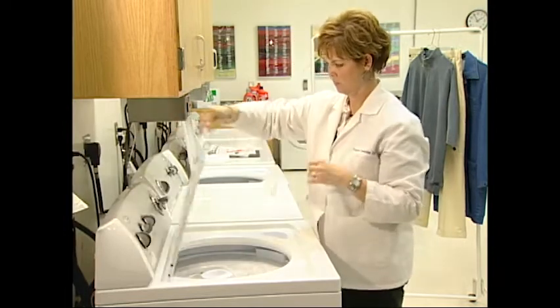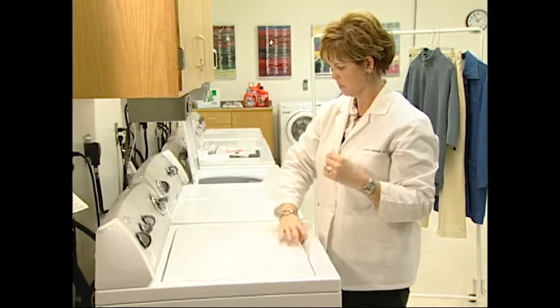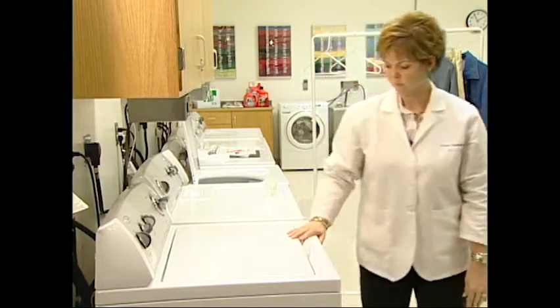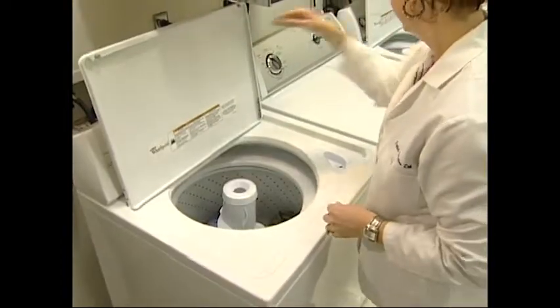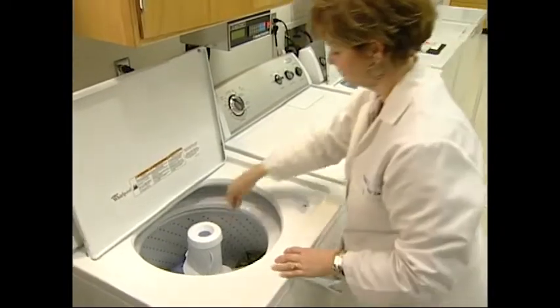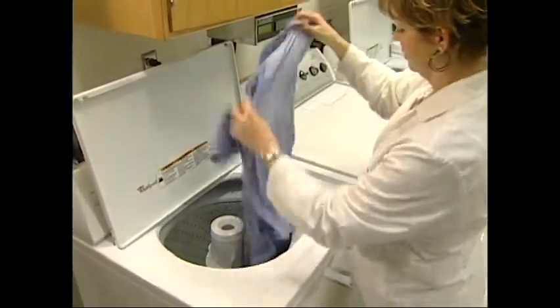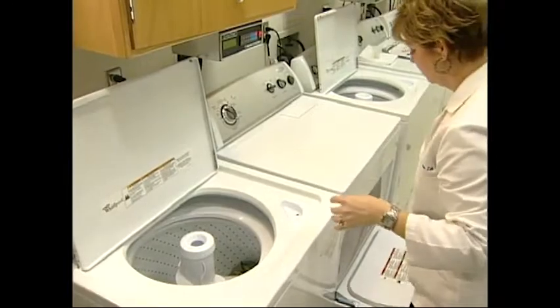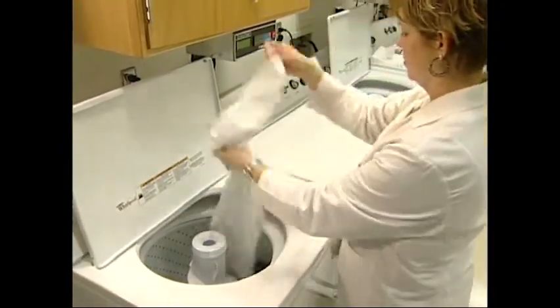In the test, the garments are washed in prescribed load sizes, water temperature, detergents, and other criteria particular to garments. After laundering, the garments are either tumble dried, line dried, drip dried, or dried flat on a screen. The procedures for drying are very similar to those for drying fabrics.